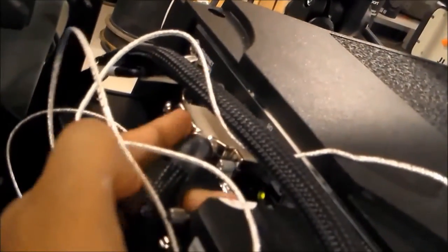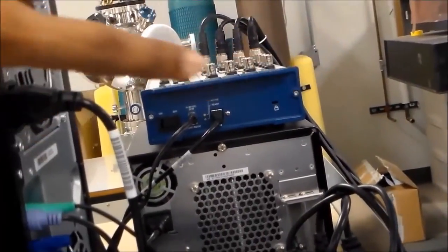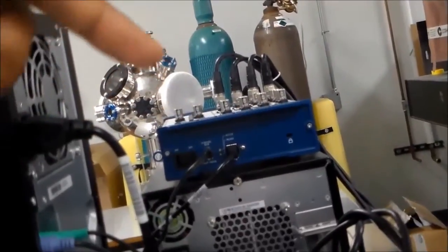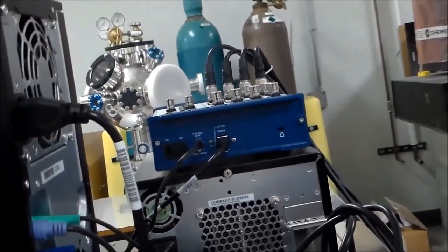So we can use that. There are 4 cables. This one takes out 4 analog signals from the frame, and we can take the data to the 3D DIC system. In this case, these are the signals it can take from the frame to further analyze.